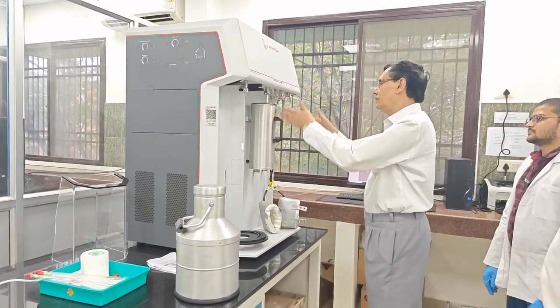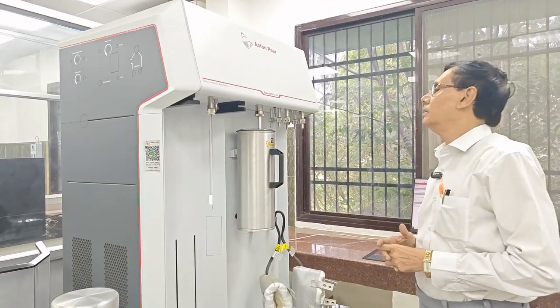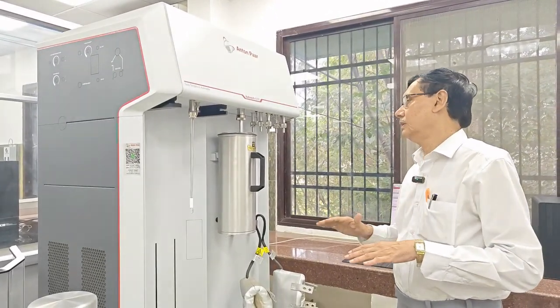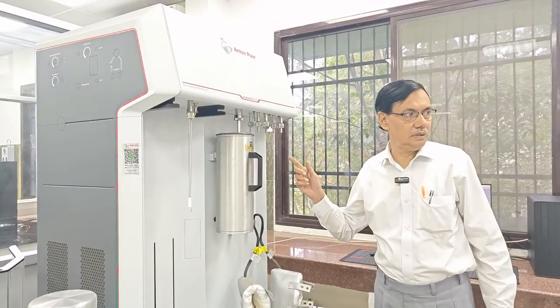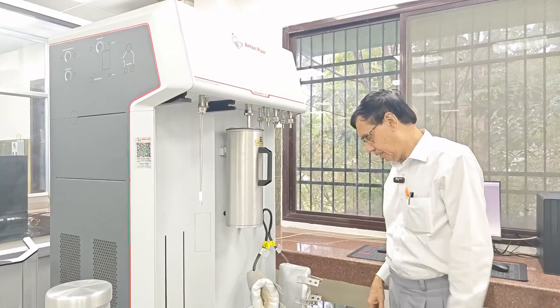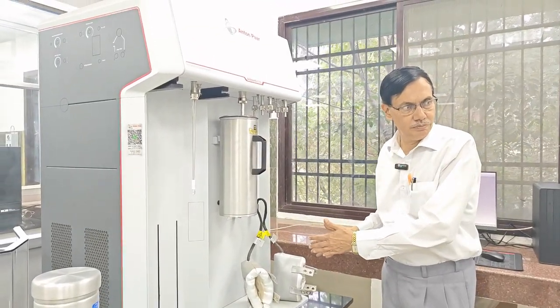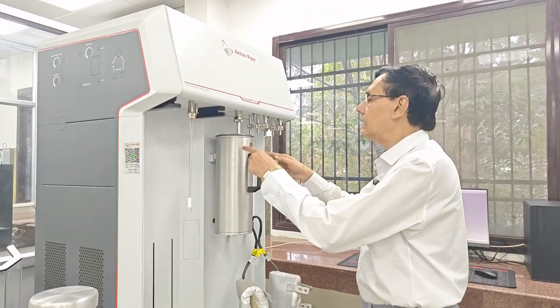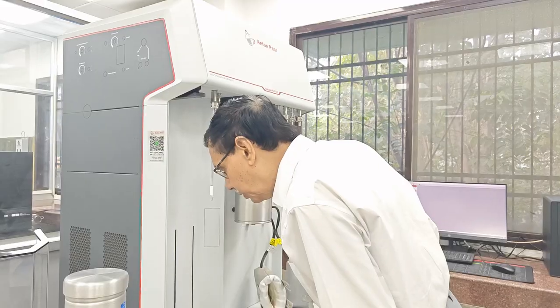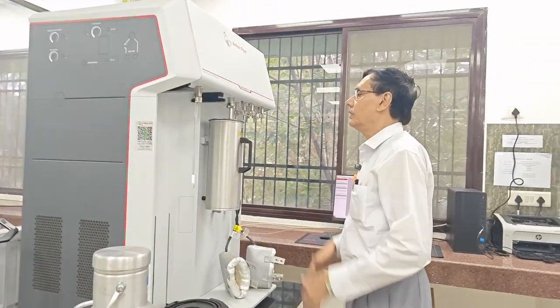The other part is very important, because that is the first part of this experiment, called degassing. Before doing this experiment, we must degas the sample, so there must be no impurities and other things. There are, I think, six chambers, but we will use only one system, and there are two heating mantles, because when we degas, it is at very high temperature and under vacuum. You also see there is another part called the cold trap Dewar. I will also explain why we use that cold trap Dewar.